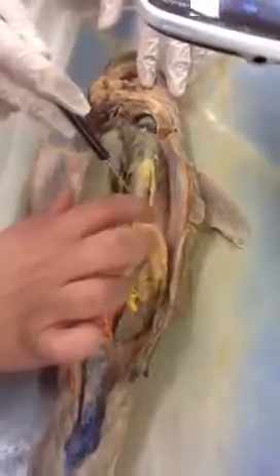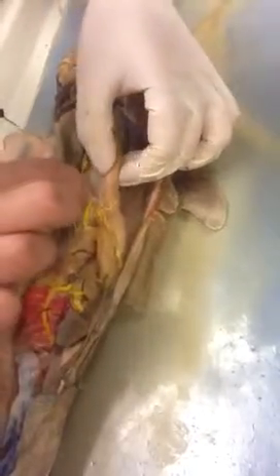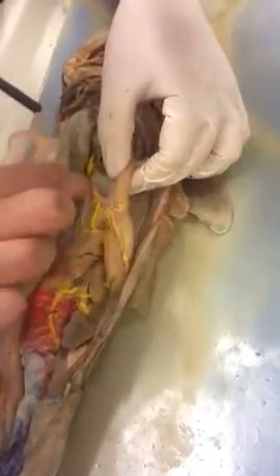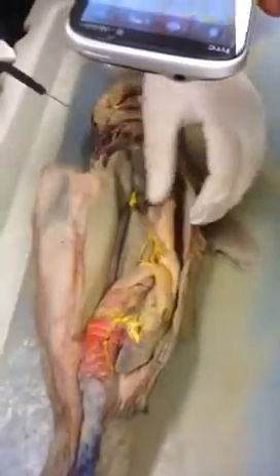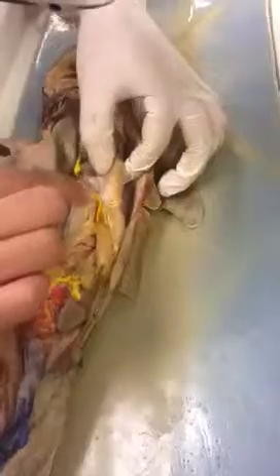Your gastrohepatic splits into your gastric artery, which is the one on the stomach, and then it doubles back to the pink going to your liver. So it's like that. That's your gastric. But then you have one that's coming back to your liver, right here. And that's the hepatic artery. Your gastrohepatic splits into your gastric and your hepatic artery. And where's the gastrohepatic? It's a very tiny portion. You can't really tell.